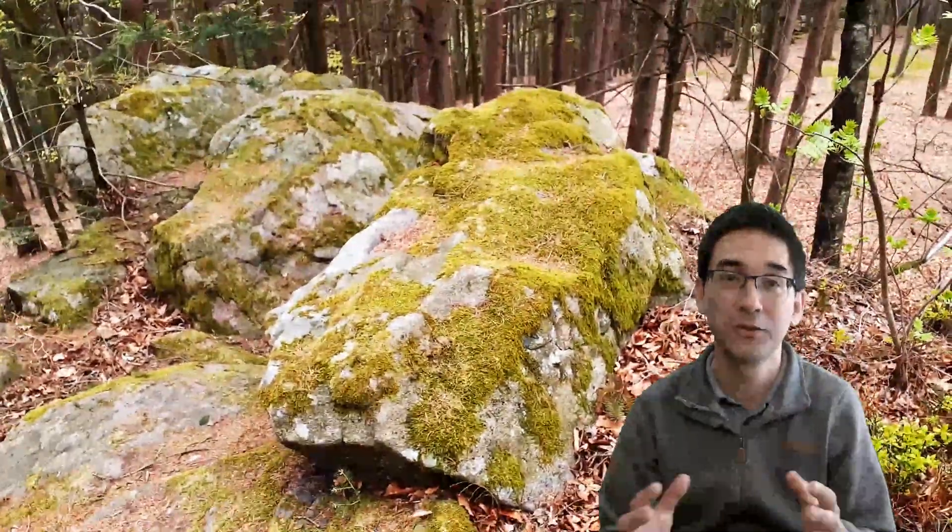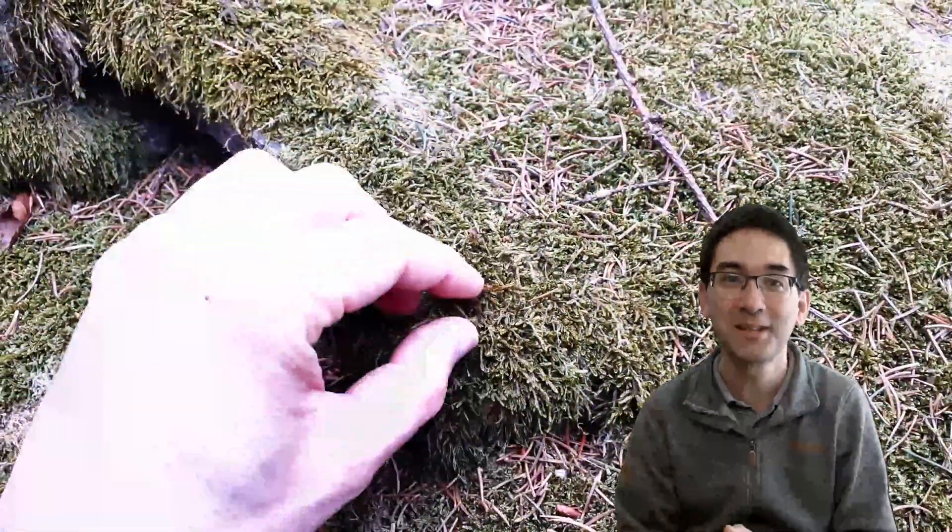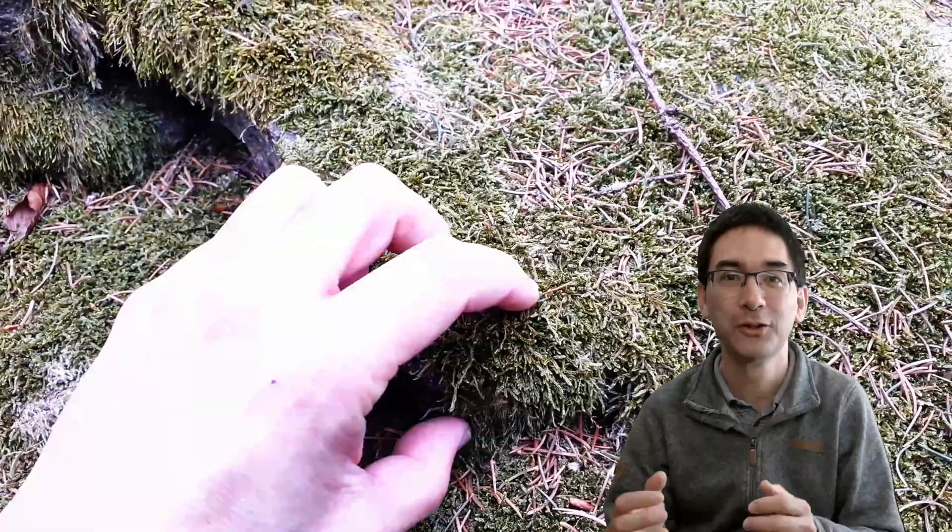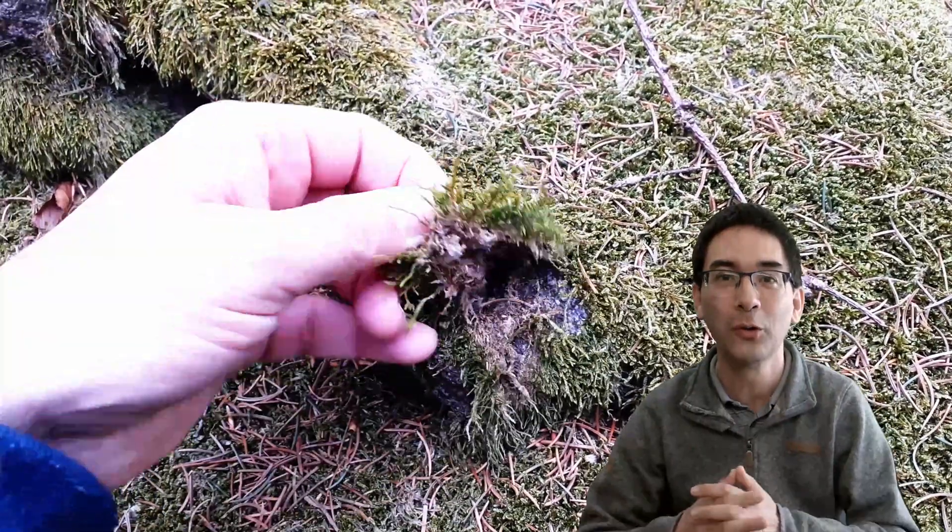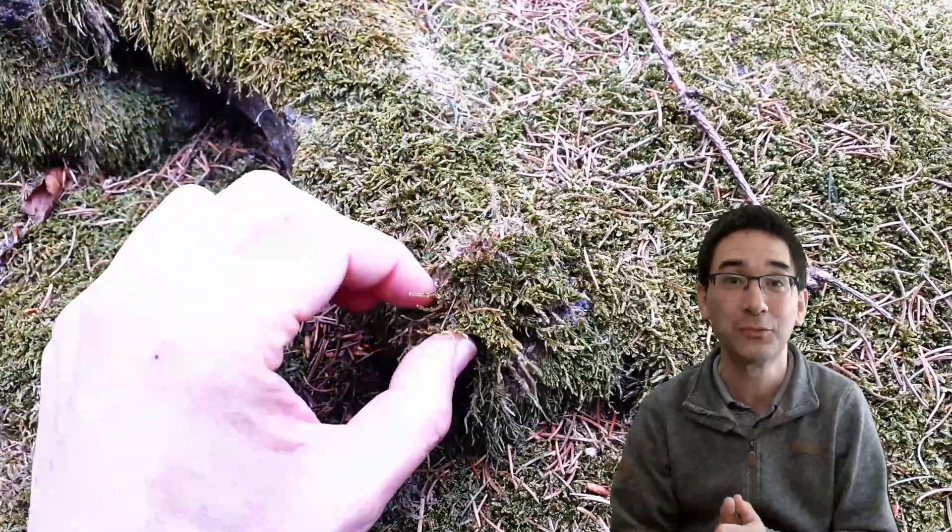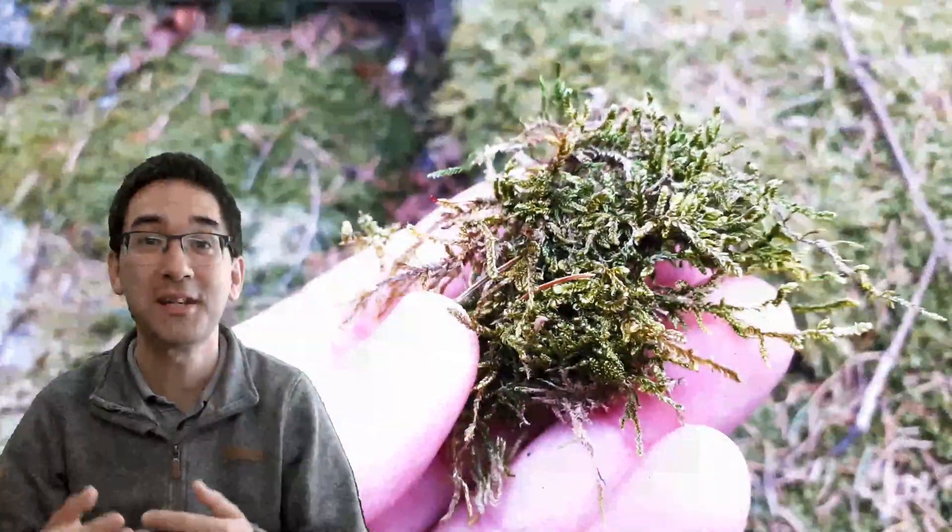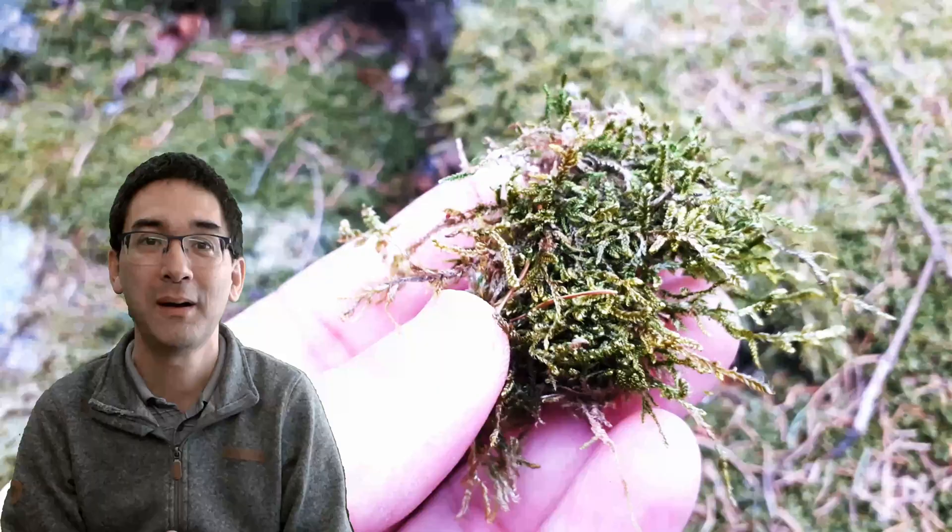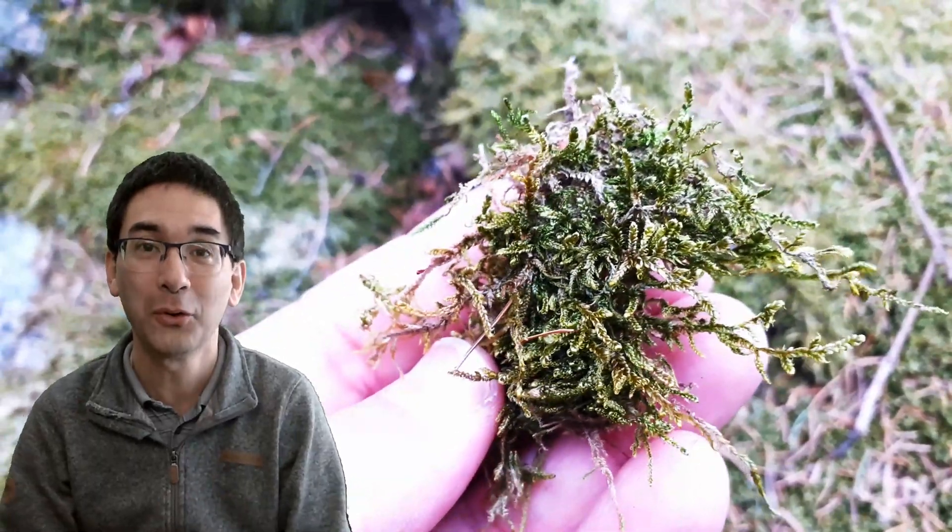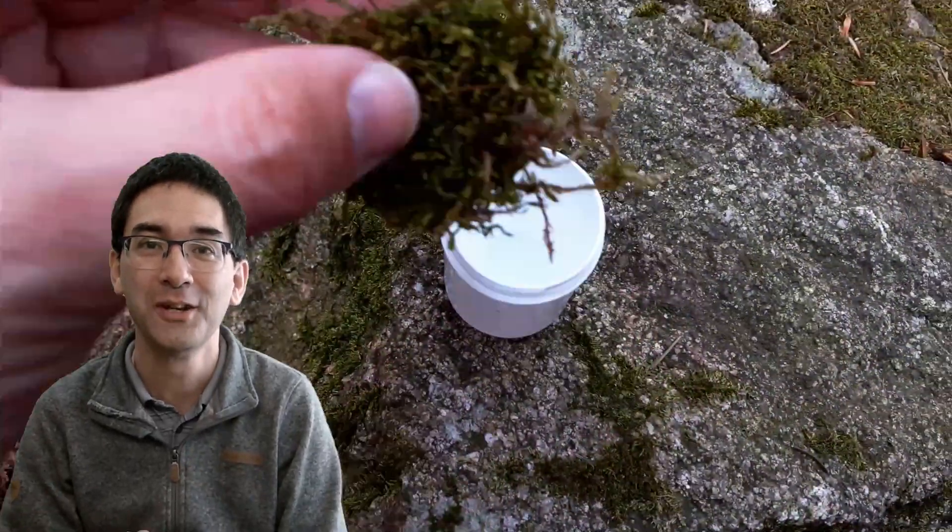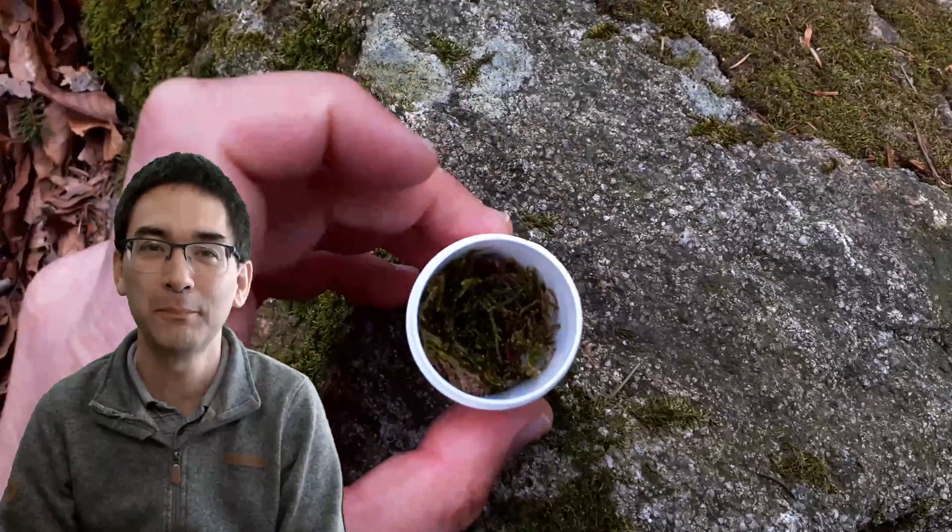Well as I walked through the forest I was first a little bit concerned that I might not find anything interesting, but then I found this gigantic rock there with the moss growing all over it. And I said, okay, that's going to be a great microscopic specimen. So of course I took along a small sample.